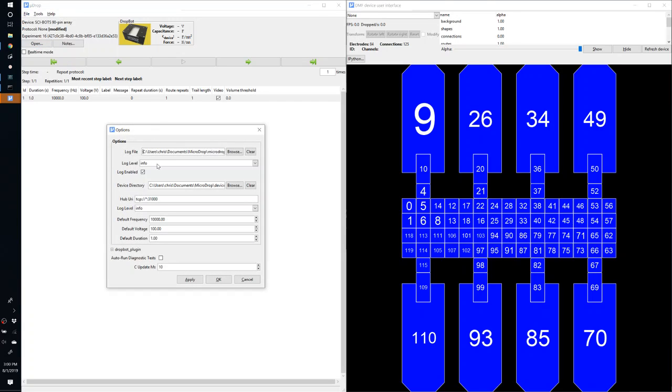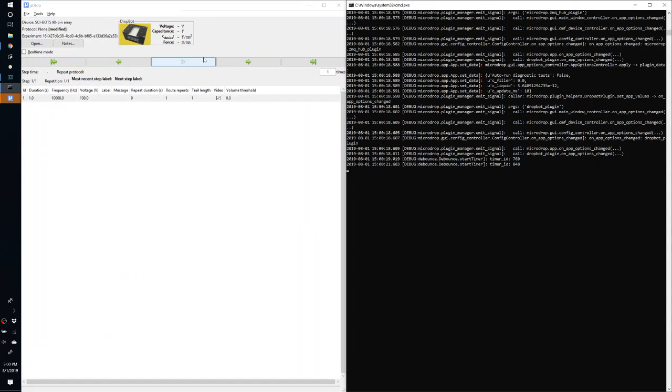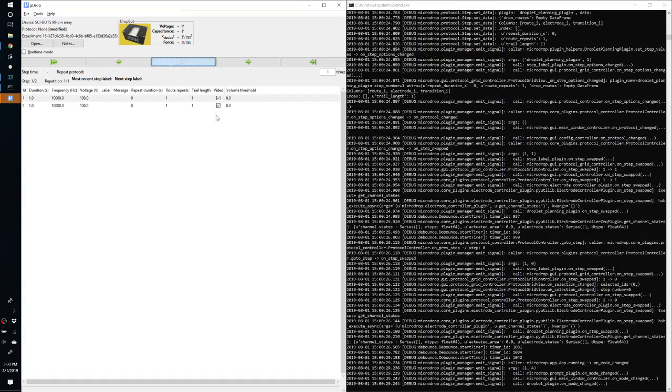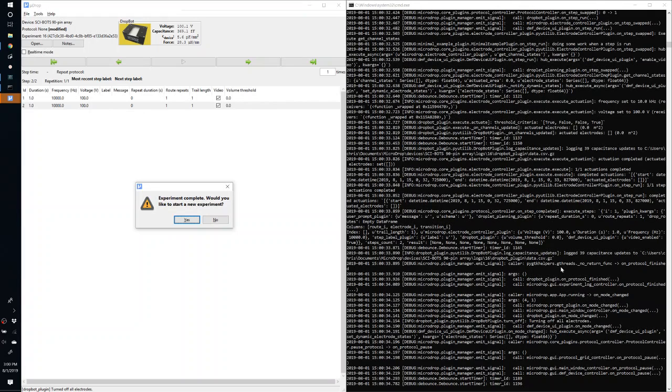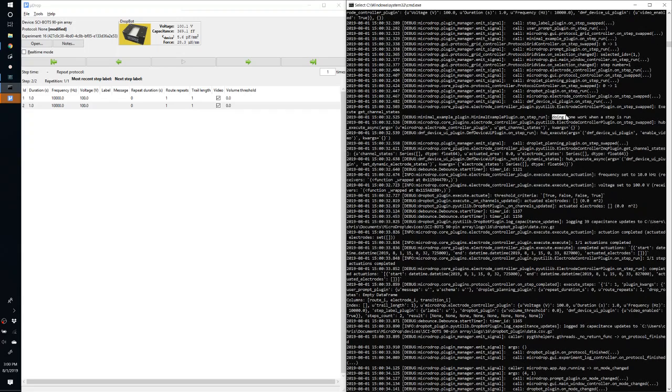The next thing we want to do is to set the log level to debug so that we can monitor the messages from this plugin. Now, if we play a protocol, we should see messages from this plugin. Okay, don't need to start a new experiment. But now we can look, here we go. So here's an example from when one of the steps was run, our message was logged as expected.